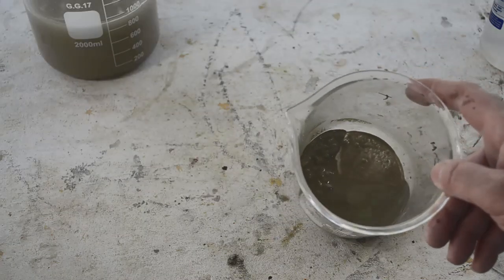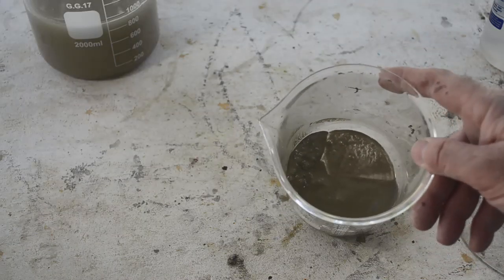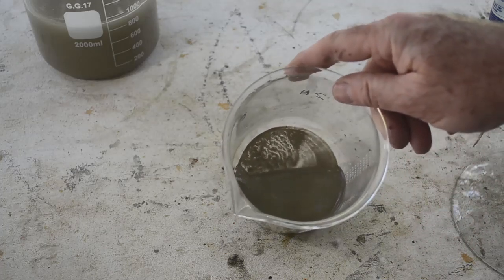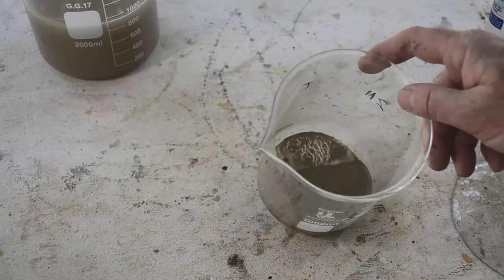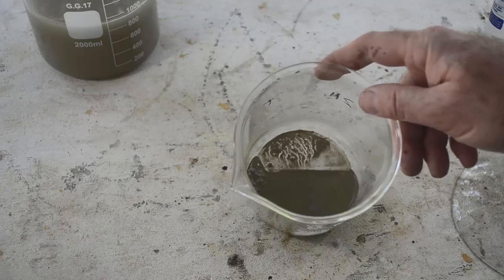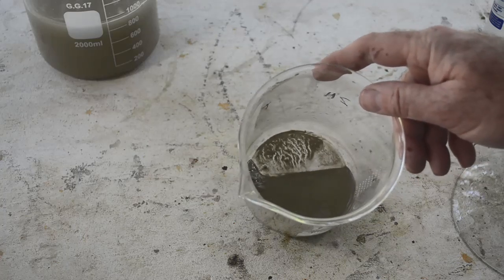Okay, so here's our silver after some washes. It's still pretty wet. I'm going to put it on low heat in the fume hood and dry it out. Then we'll be able to weigh it and see how much silver we've got here. Looks pretty good, just very fine. But it came from very fine, fluffy silver chloride. So that's probably why it looks so fine.